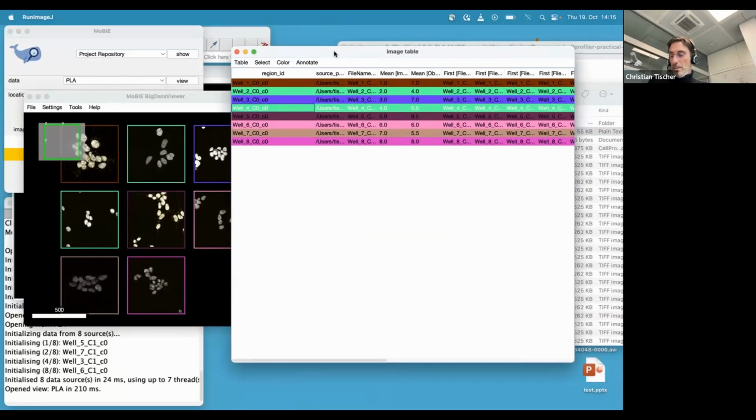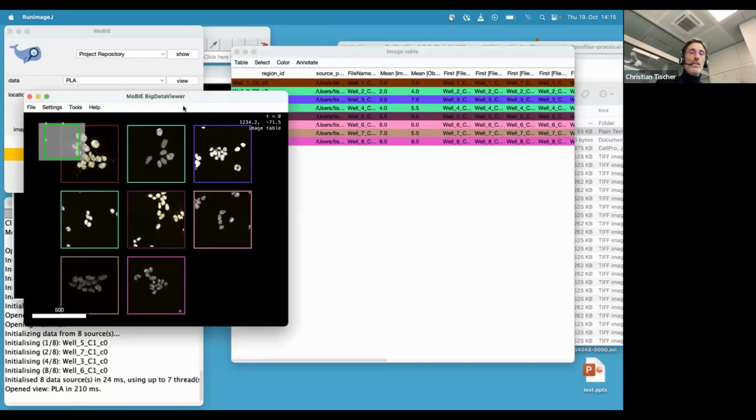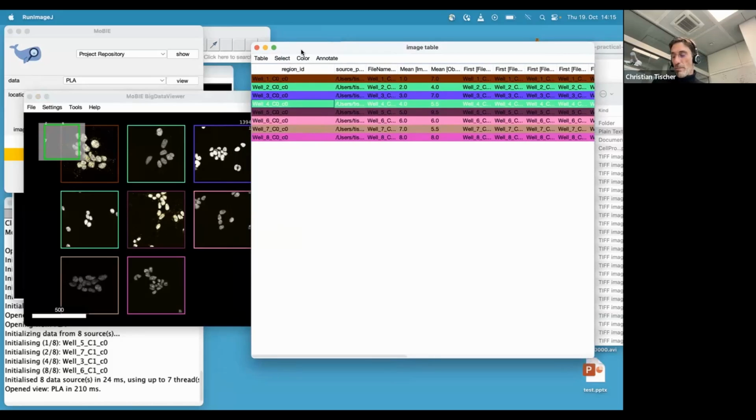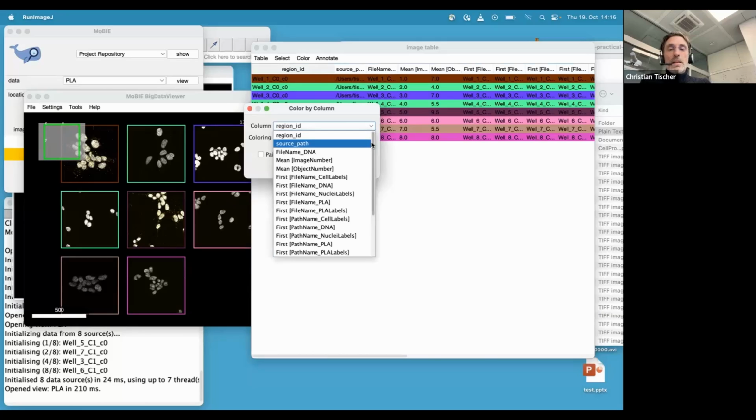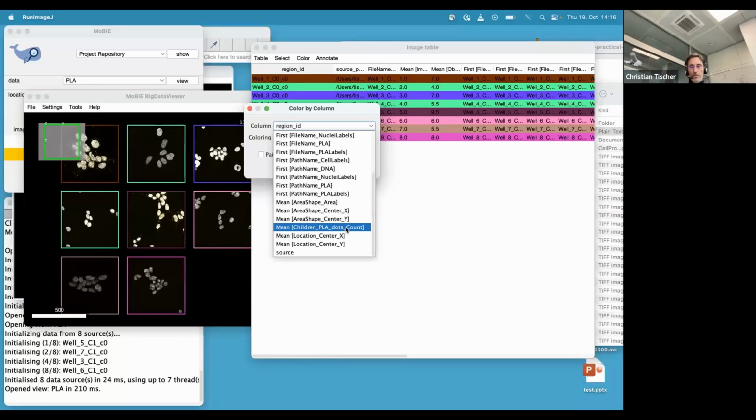Then another thing, so you can have convenient browsing of the whole data set. And another thing you can do is, these colors right now are random, but you can actually color it by something you biologically care about. So for example, we color by, and these are actually the CellProfiler column names. So nothing has been changed. This is a column where for each image, CellProfiler computed the average number of PLA dots that each cell had. Okay, so if you do a high throughput screen, that's often actually the thing you care about, right? In the whole image, on average, what was each cell doing?